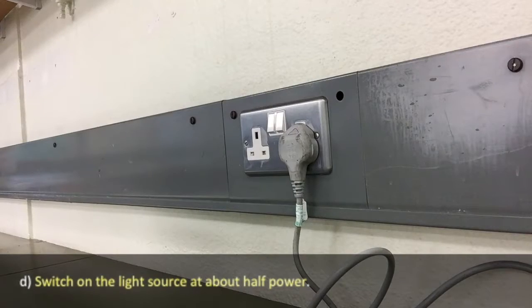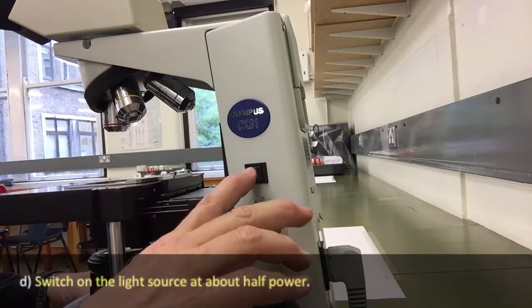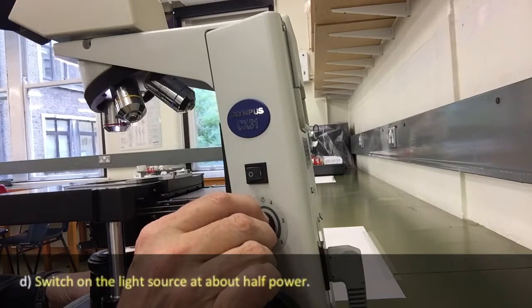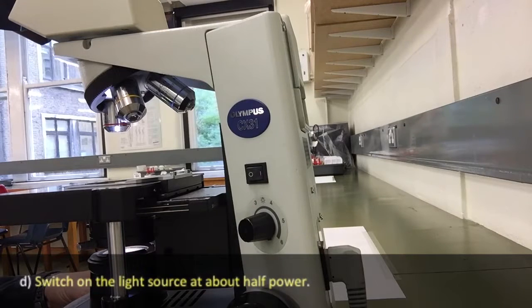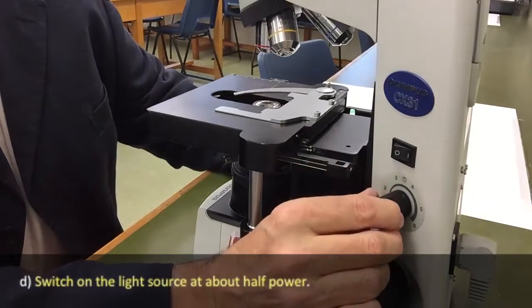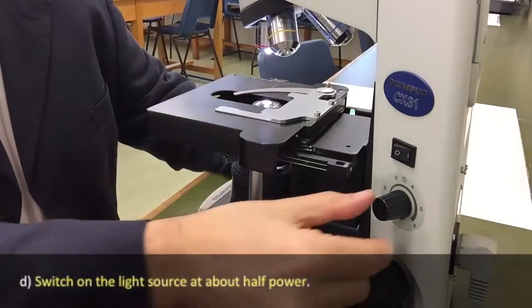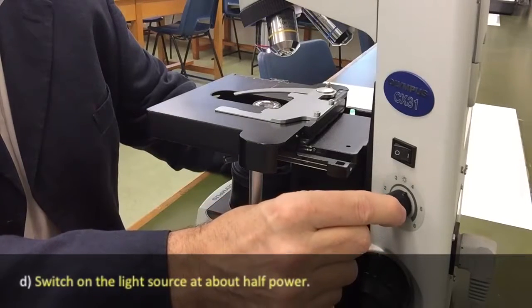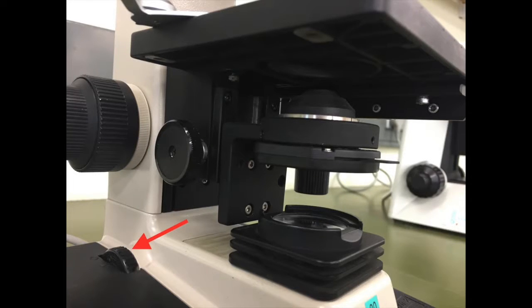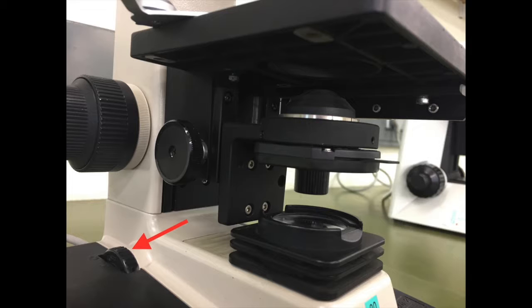Now switch on the light source and adjust it to about half power. First plug the microscope in at the wall and switch it on, then switch it on at the side and turn up the light all the way around initially and then back to about halfway — about 50% illumination. You can see the light shining through the condenser. For those of you with Nikon microscopes, the adjustment switch and dial is on the left-hand side of the microscope at the base.